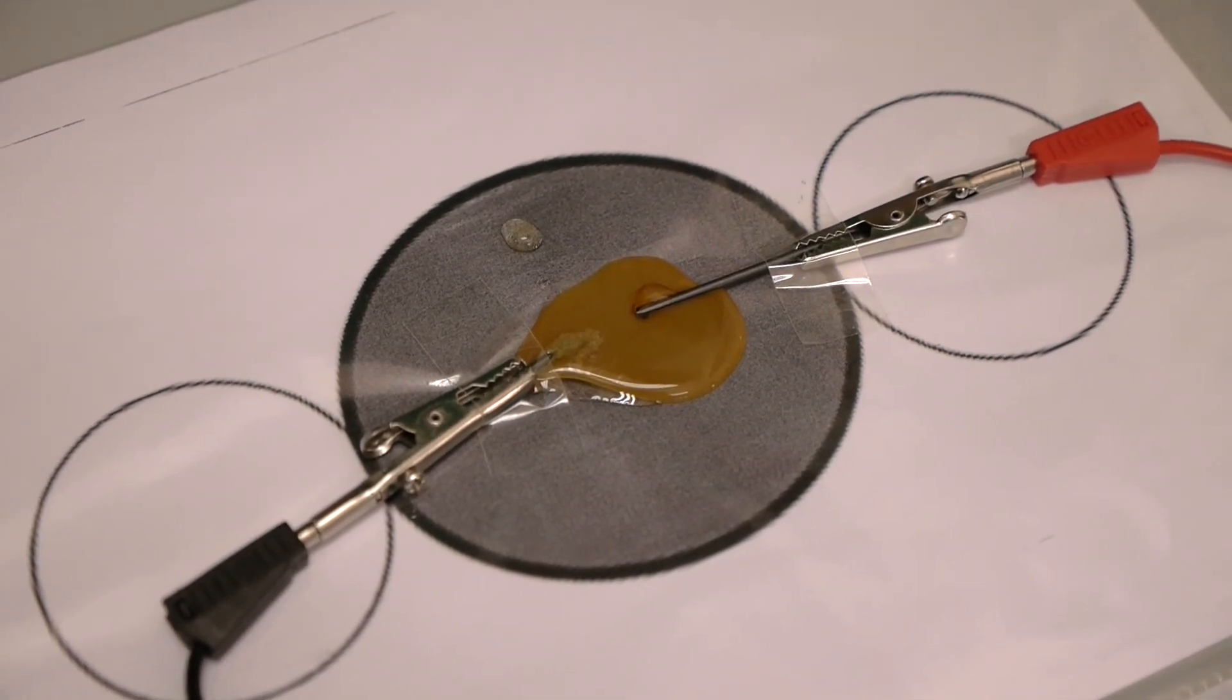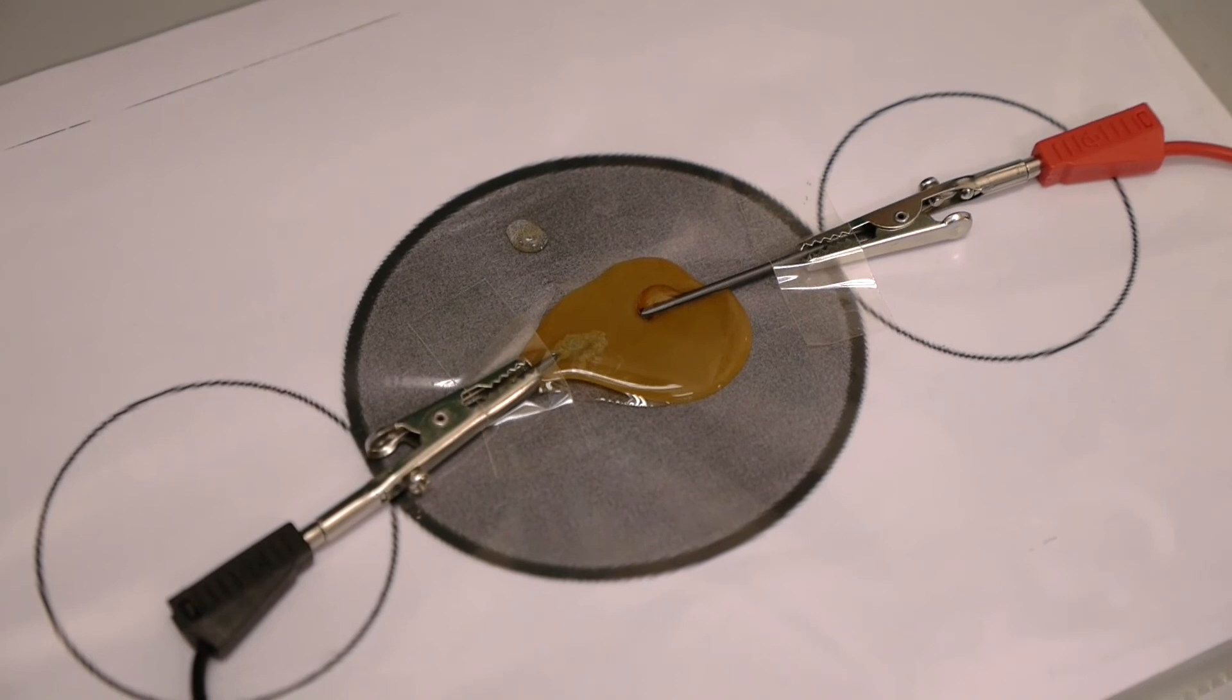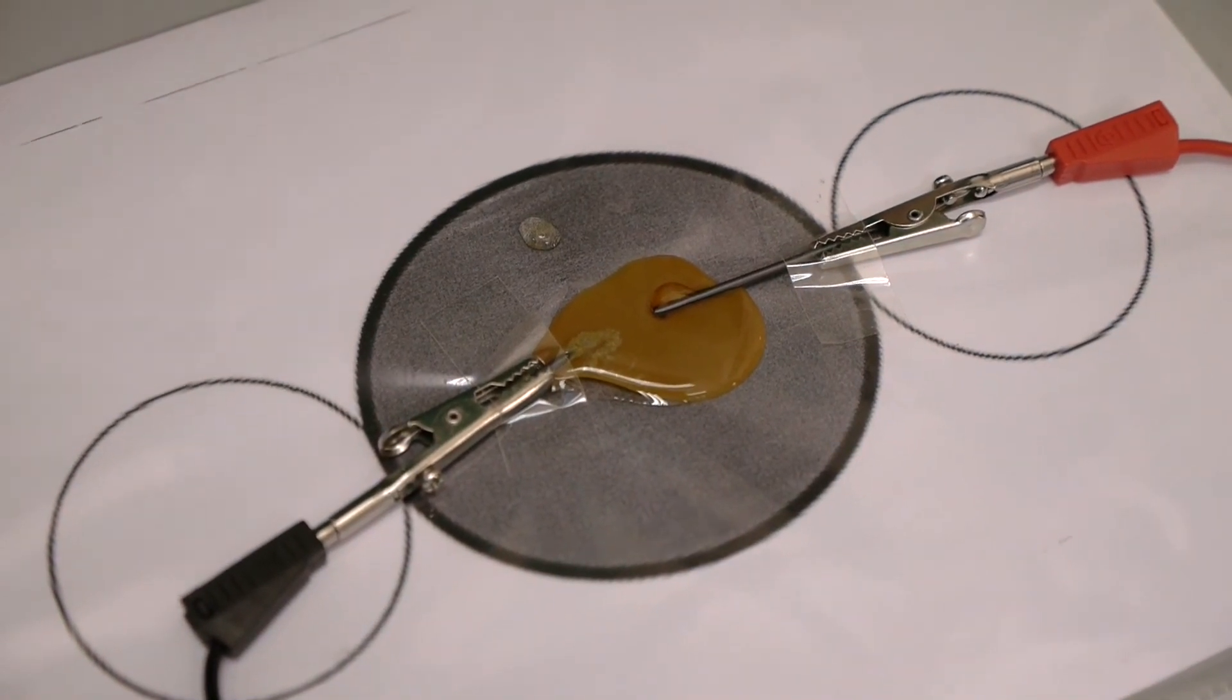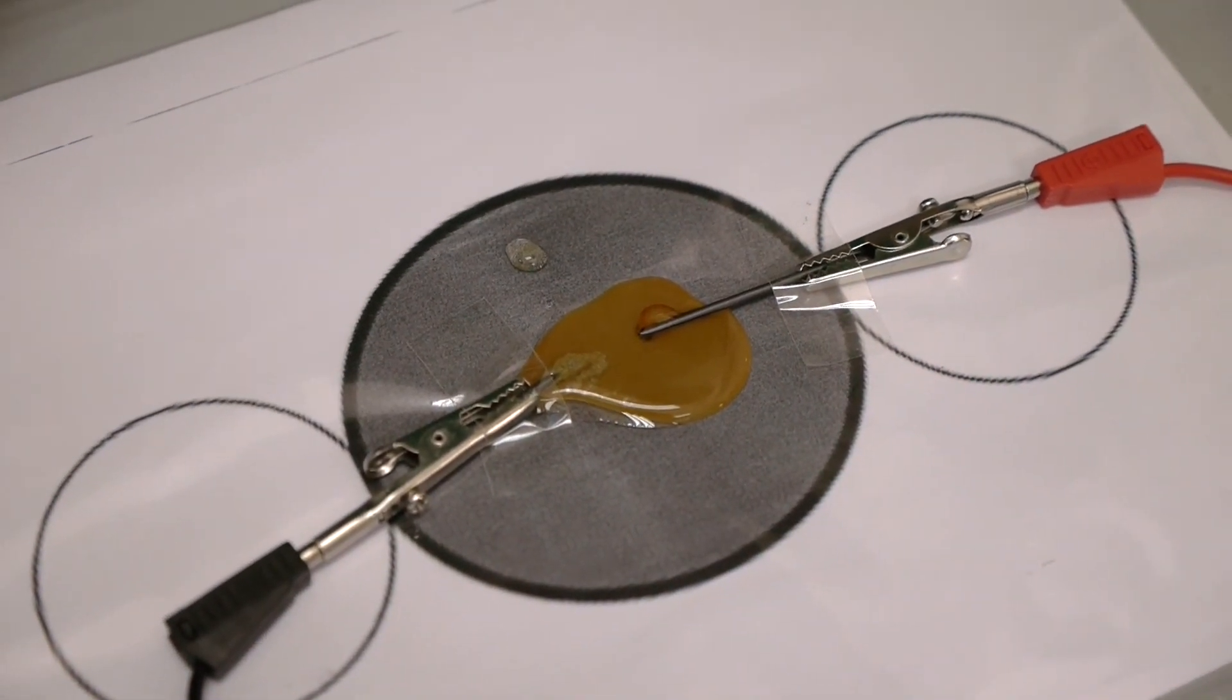To see a more pronounced version of the electrolysis you can increase the voltage and it will be clearer visually.